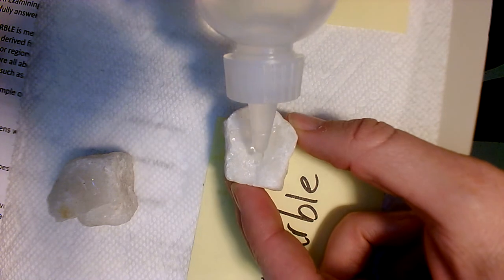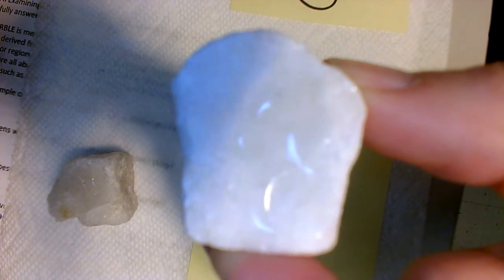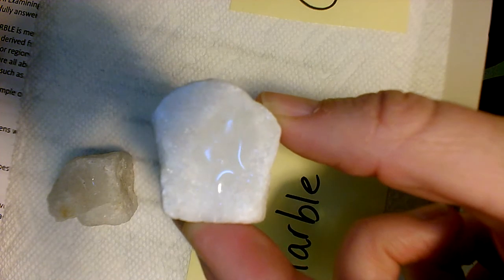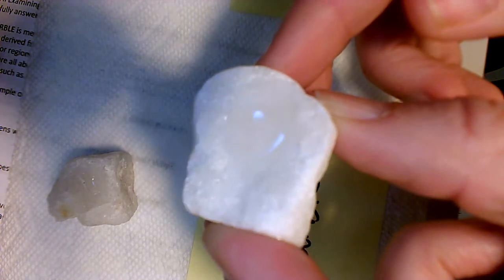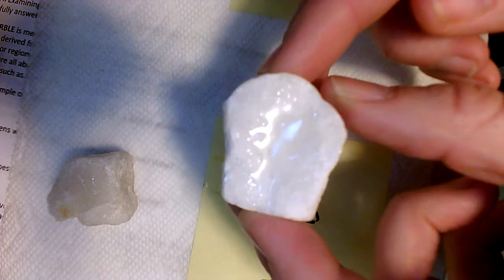I'm going to try a different sample right here. And so there, I'm actually hearing fizzing right now. It's hard to see because of the white on white. But this sample is reacting with the hydrochloric acid.